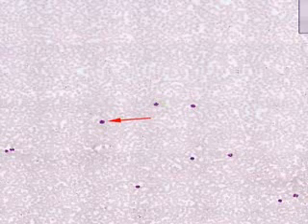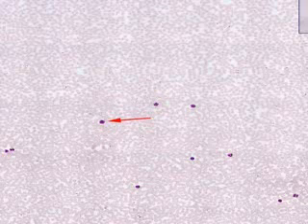Here is a classical smear of blood. It's called a peripheral smear. In a peripheral smear, the stain that is used is not H&E. It is called a Wright's stain, which is a slightly different type of stain, but nevertheless, nuclear material is more bluish, and cytoplasmic or non-nuclear material is more pinkish or reddish. There are several different types of cells classically on a blood smear.